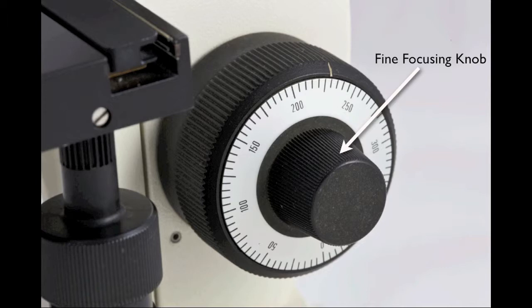This is the only knob that you should use when viewing objects with the high power or oil-immersion objectives. These lenses are almost in contact with the slide, and moving the stage upward too rapidly might easily break the glass.